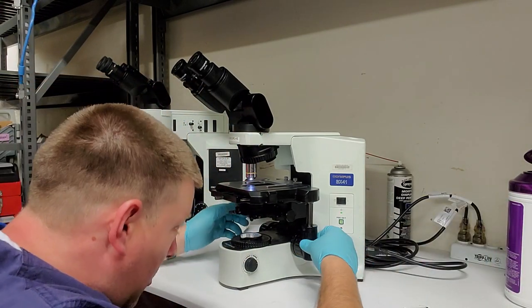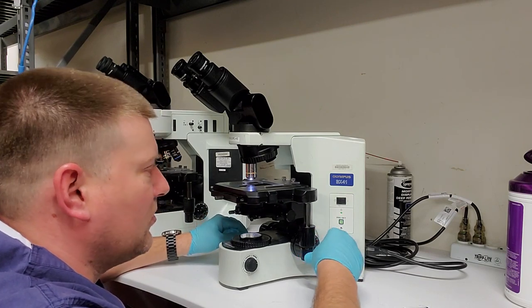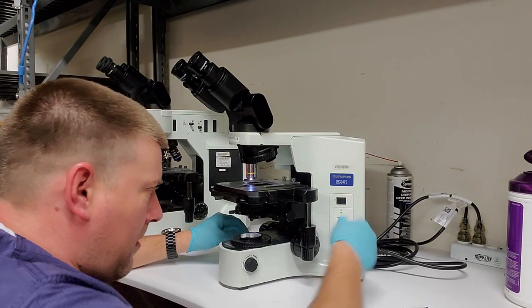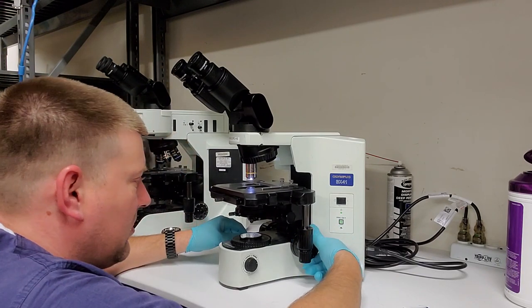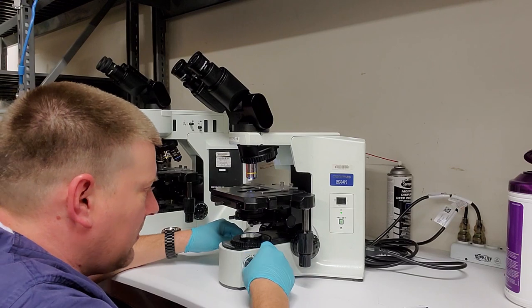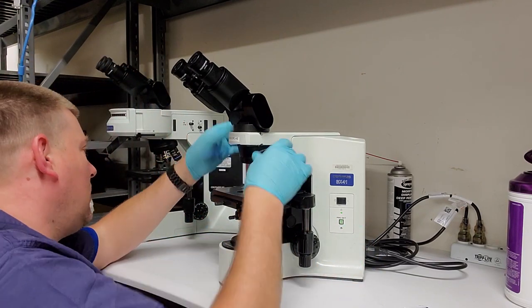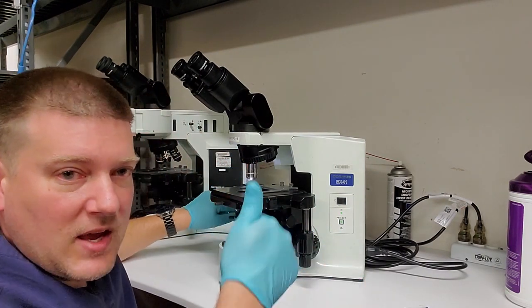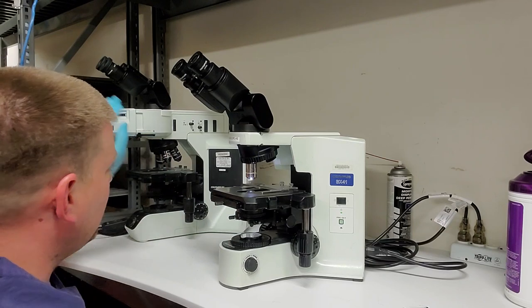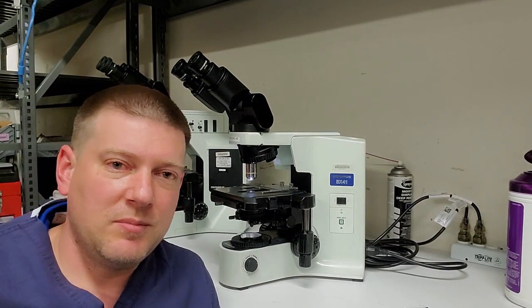Okay, so I'm not going to lubricate the ways on this guy because it's actually looking really good. The tension ring works really good. Everything is looking really good on this guy. Dimmer, my optics are clean. So this microscope here just needs an electrical safety check and it's good to go. This one over here, just got a few more things to check, but it's basically the same process.